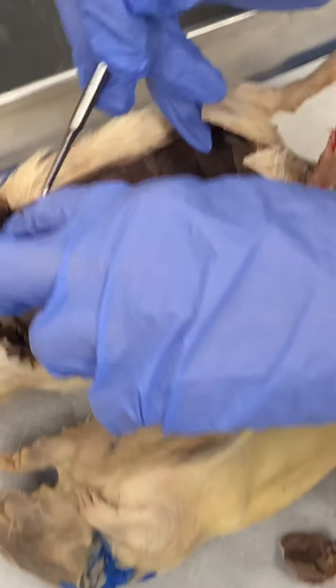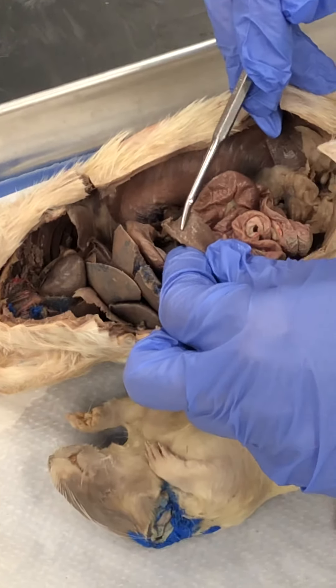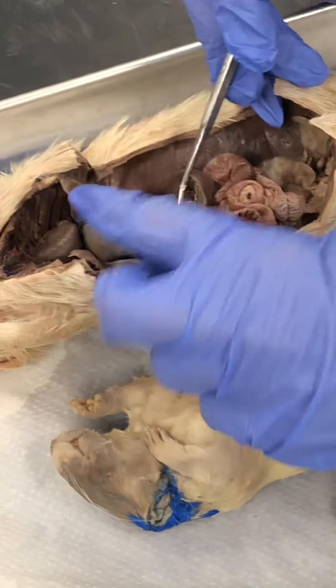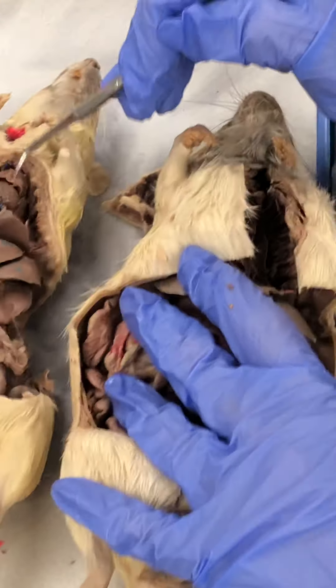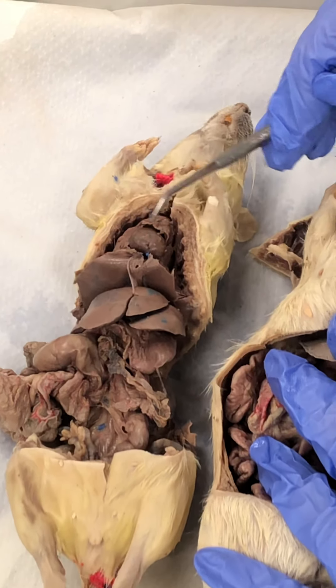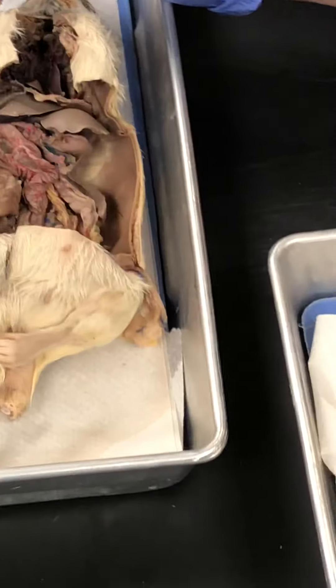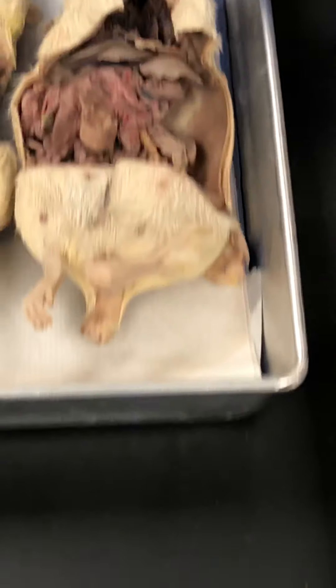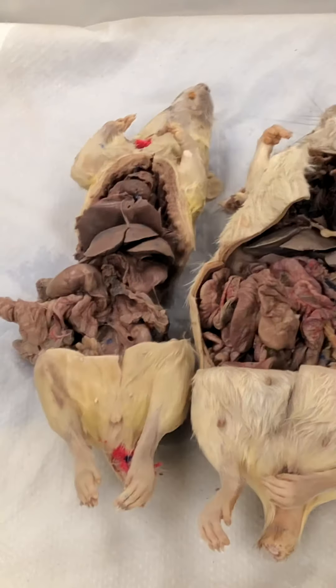Here's your spleen. And this is the thymus — it looks like a little cap sitting on top of the heart. You don't have to know any endocrine glands.